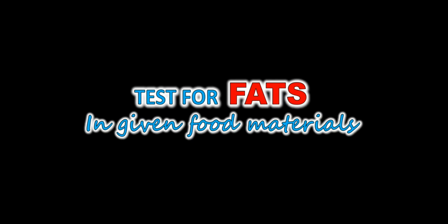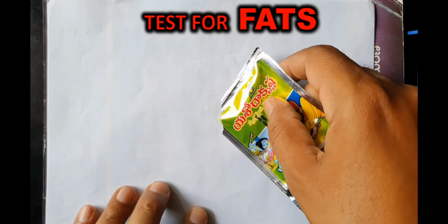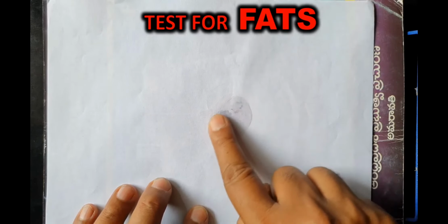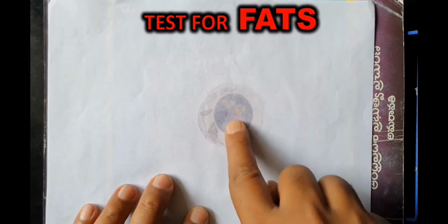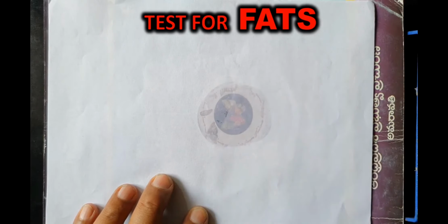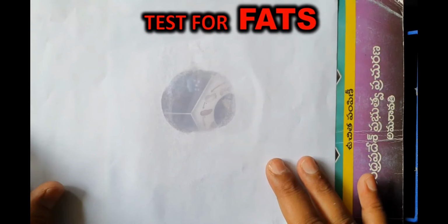Now the third test is the test for fats in the food materials. For this test we have to take a food sample, this is ghee, and rub it gently on a piece of paper. If the paper turns translucent, then the substance contains fat. You can see that the paper has turned translucent, hence fats are present in ghee.